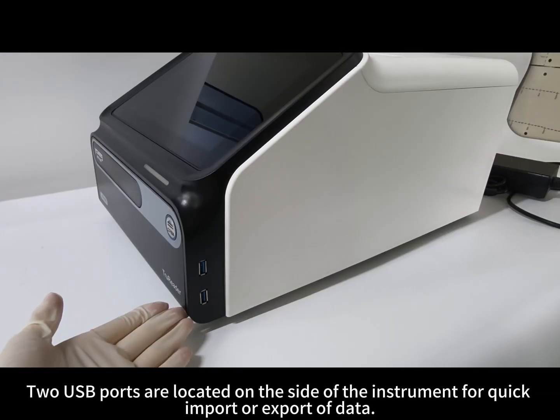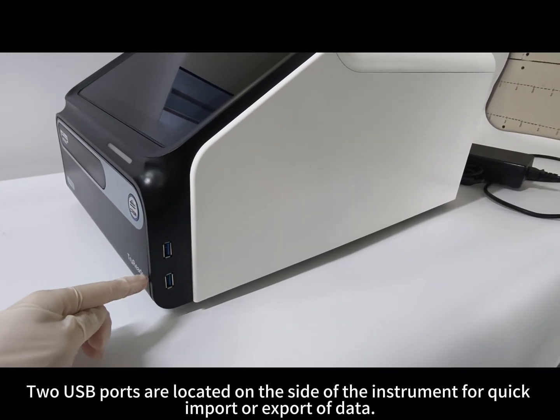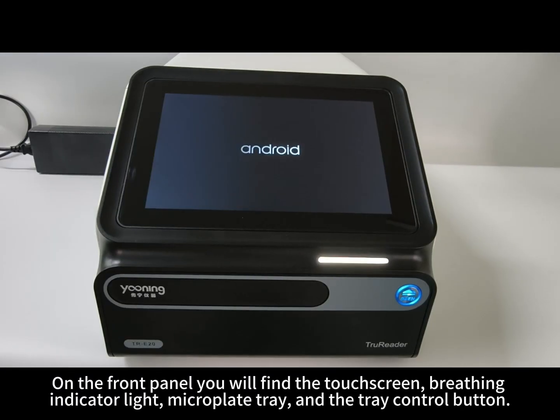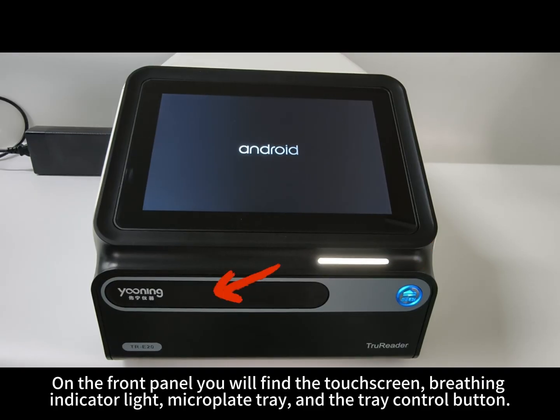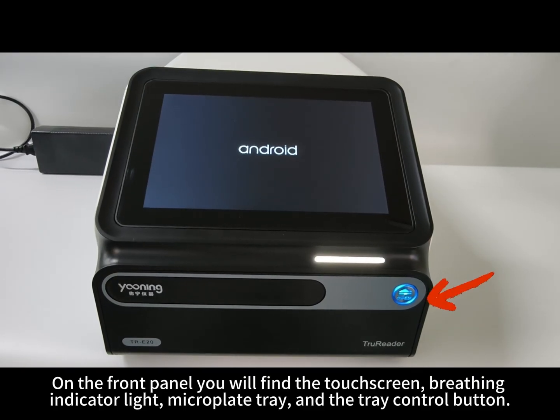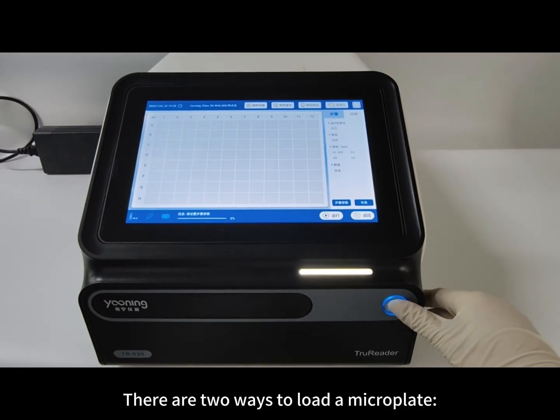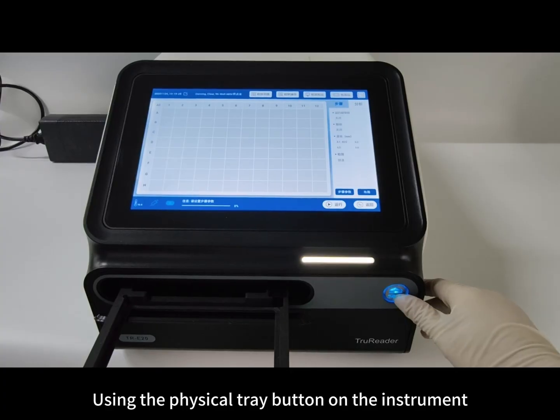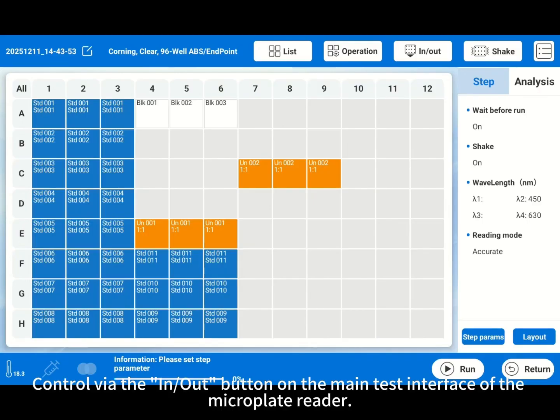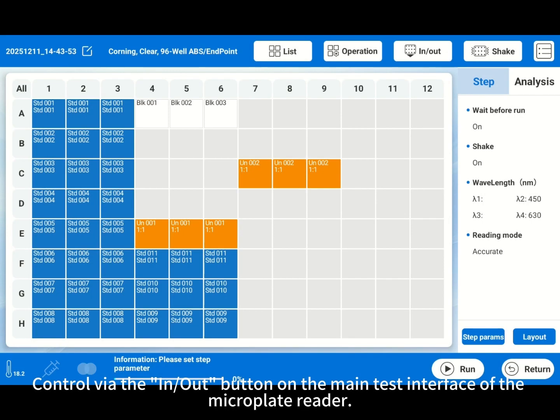Basic overview. The USB ports are located on the side of the instrument for quick import or export of data. On the front panel, you will find the touch screen, breathing indicator light, microplate tray, and the tray control button. There are two ways to load the microplate: using the physical tray button on the instrument, or the in/out button on the main test interface of the microplate reader.